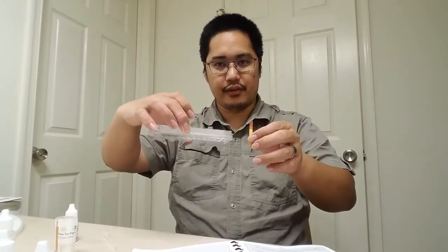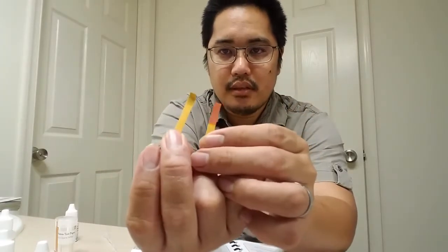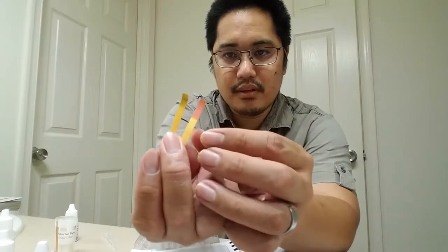Let me just show you real quick. I'm not going to do all of them for you, but I put it in A1. I'm also going to try it in A12, and I'm going to show you the difference. So you can see that there is a difference between those two.